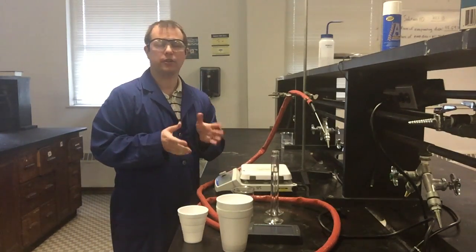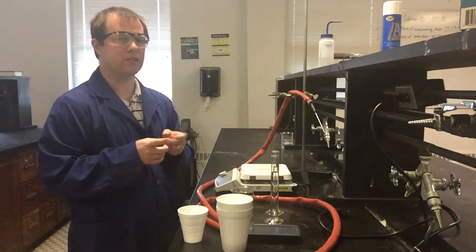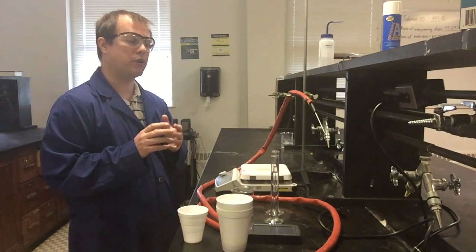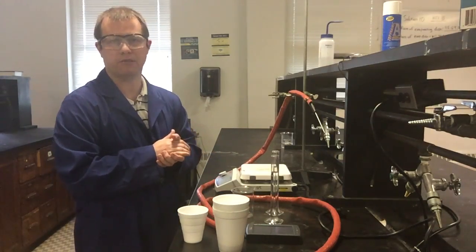Now, one other thing we're going to take into account in an effort to be as accurate as we can be with our data is we're actually going to do this experiment in two parts. So the first part of this experiment is actually going to deal with just hot and cold water and not an acid or a base. And what we're going to do is basically take hot water and cold water. We're going to mix them up in our little calorimeter cup that we'll be using later for the acid-base reaction.